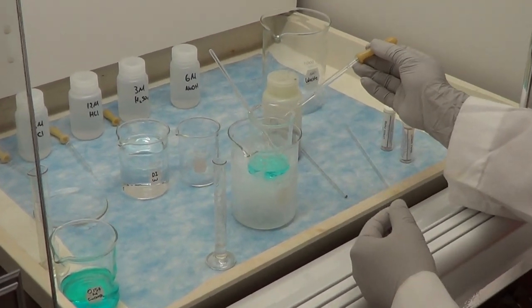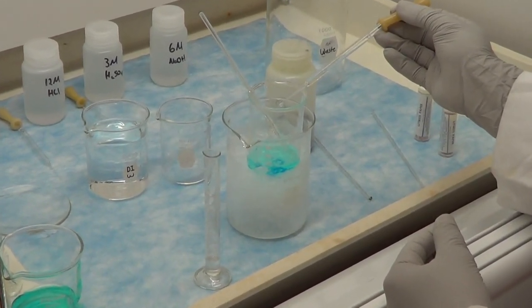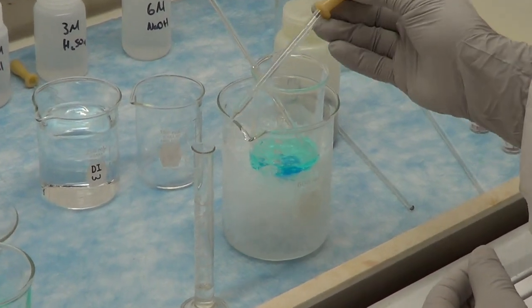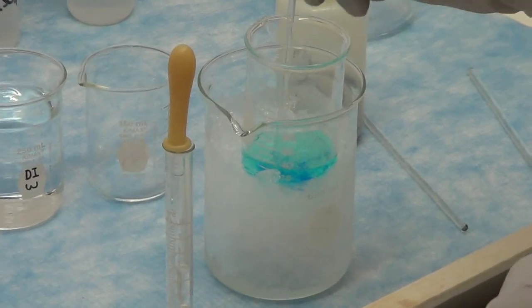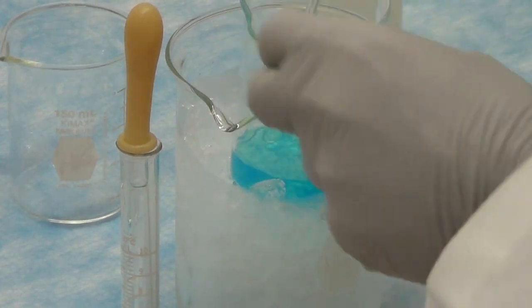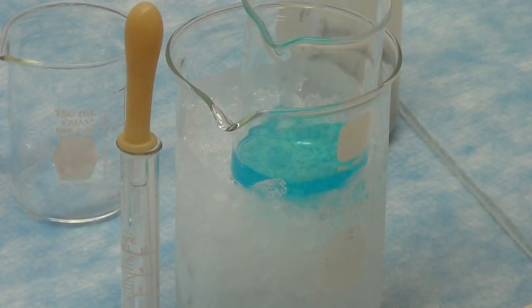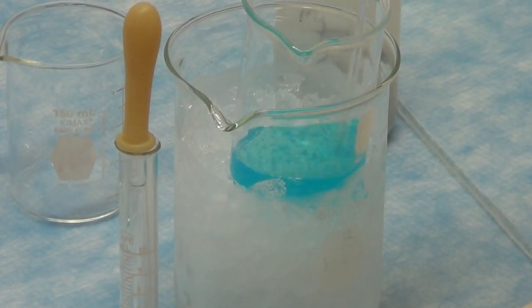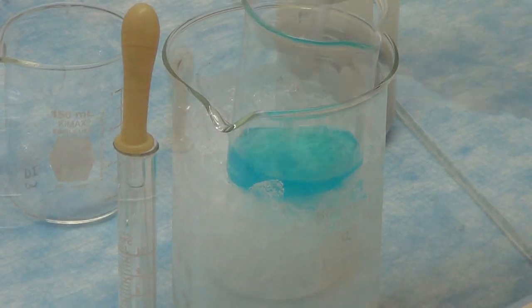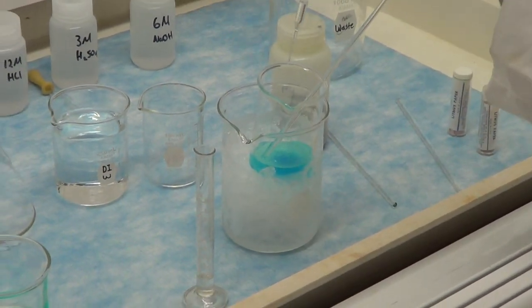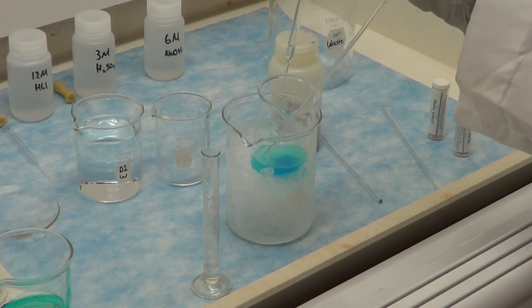This is a time consuming as well as very important part of the lab. Here copper nitrate is reacting with sodium hydroxide to form copper hydroxide and sodium nitrate. This is a typical precipitation reaction where heavy metals form insoluble hydroxide which can be precipitated from solution using soluble hydroxide such as sodium hydroxide.